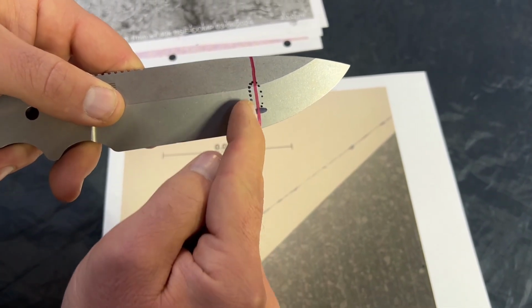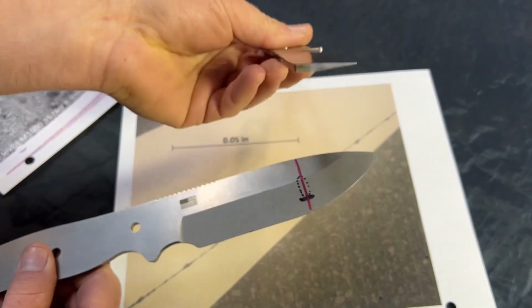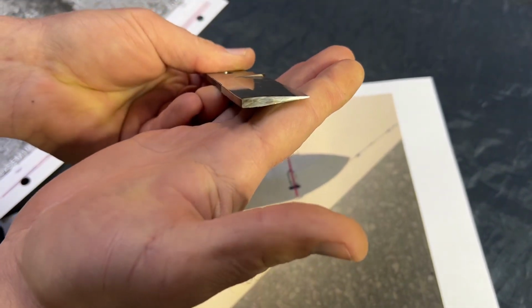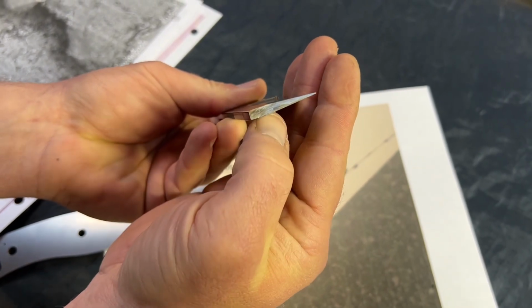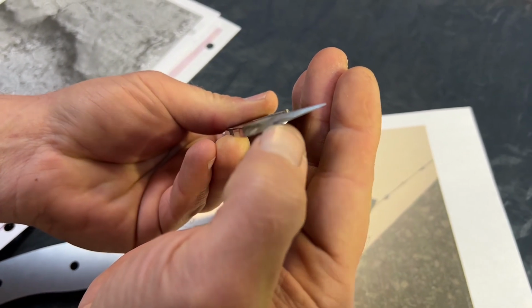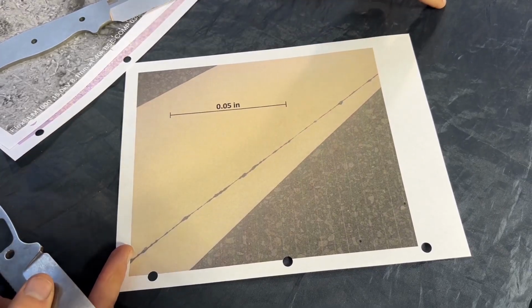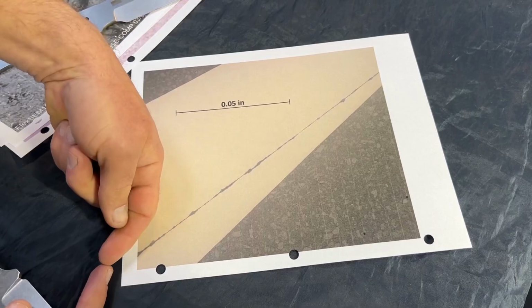So basically what we're looking at in this image is this. What they did is cut the anomaly in half, cut the part, and then we're looking in at the part from this side. So when you see a thin line coming across here, it's just what you can see from the side. After they've cut into the interior of the part, you can see the bevel leading up to the anomaly where it would have broken off out of the surface way over here. And then God knows how far it goes into the part on the other side.